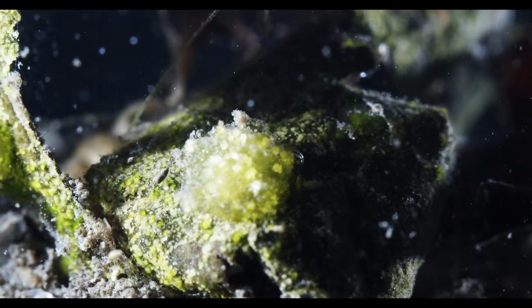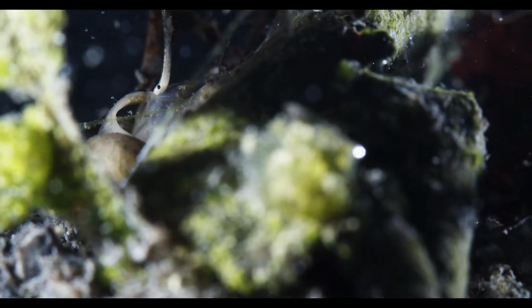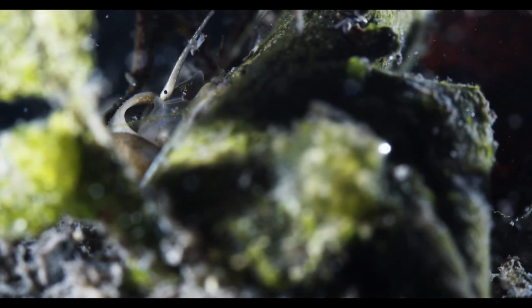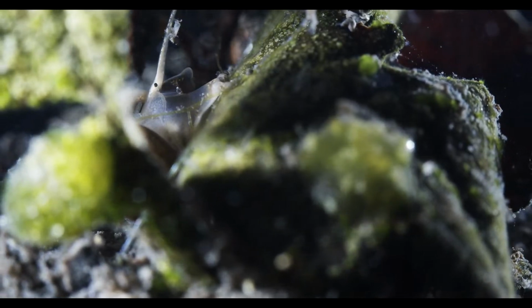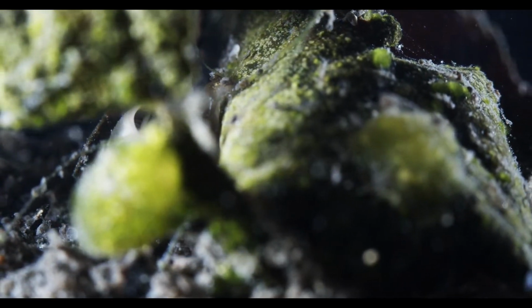We've got a fresh sample today. We've got a kind of a cold spell these last days. Actually saw some snow today. Ah, Gecko Guy is here from the Micro Forum. Welcome, nice you're here.